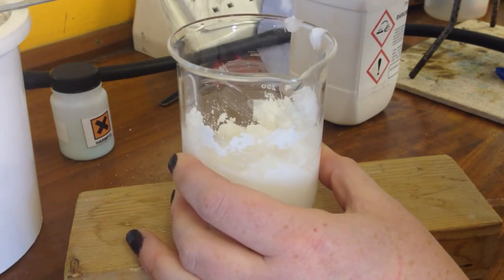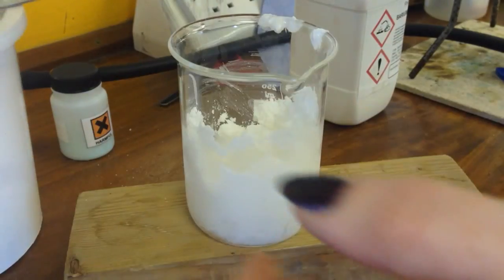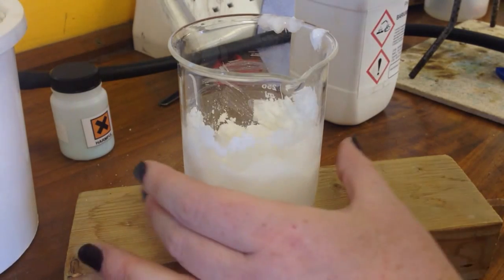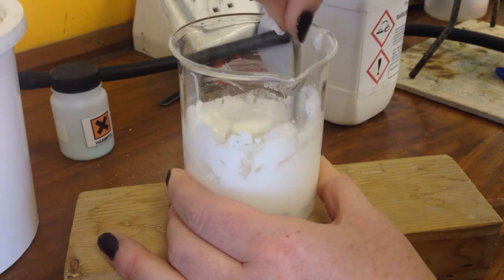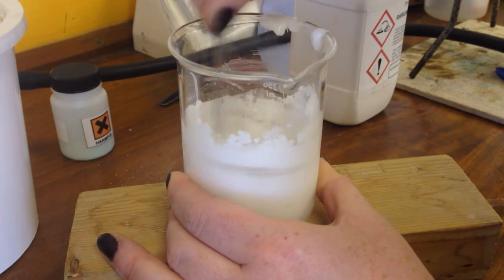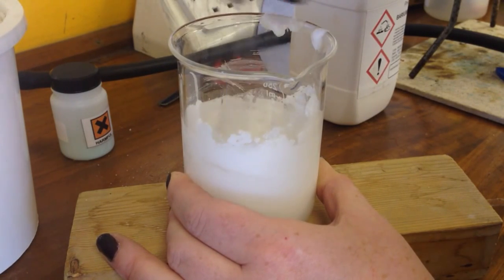So I'll take the thermometer out so I don't break the thermometer now. And go back to using a spatula. So this is quite hard to stir, but it's actually turning into a liquid form. There we go. It's gone completely liquid.